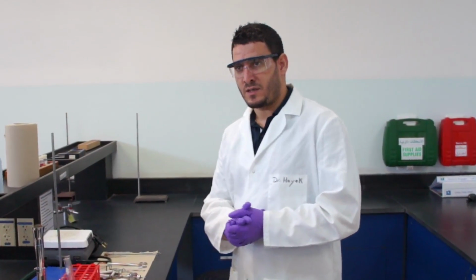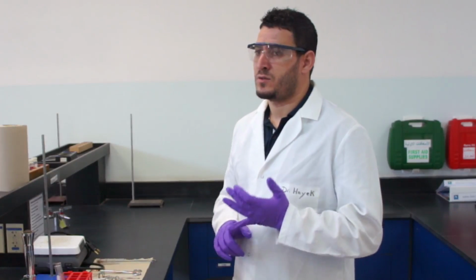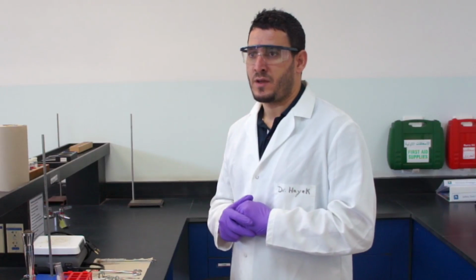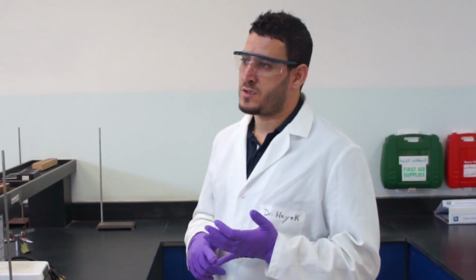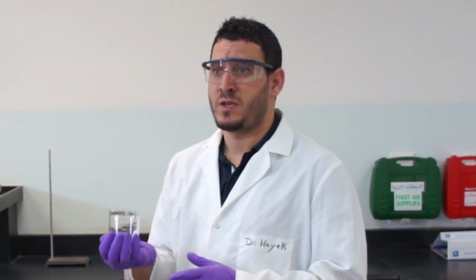We have talked about this in the class. Physical change: the indications of physical change could be odor, color, or changing state from solid to liquid to gas, etc. Now, for chemical change, we said that the indications are precipitation, gas evolution. Also, it could be a change in color. It could be evolution of heat. If you touch the container after mixing the reactants and you feel that the temperature is getting hot, or it could be getting cold.